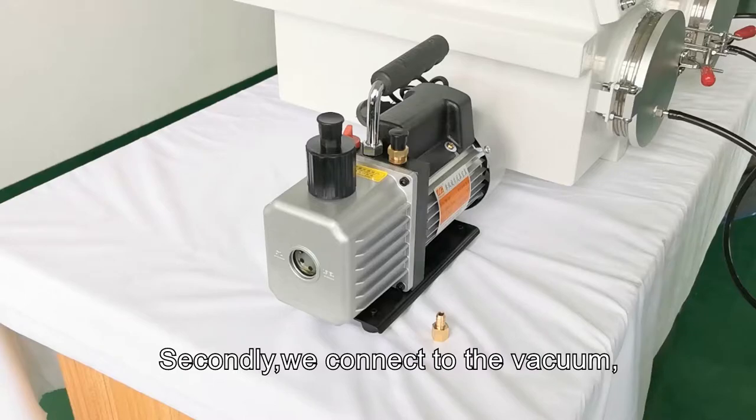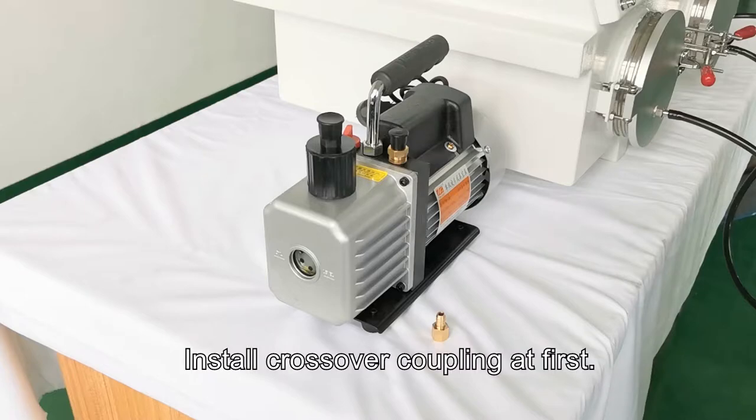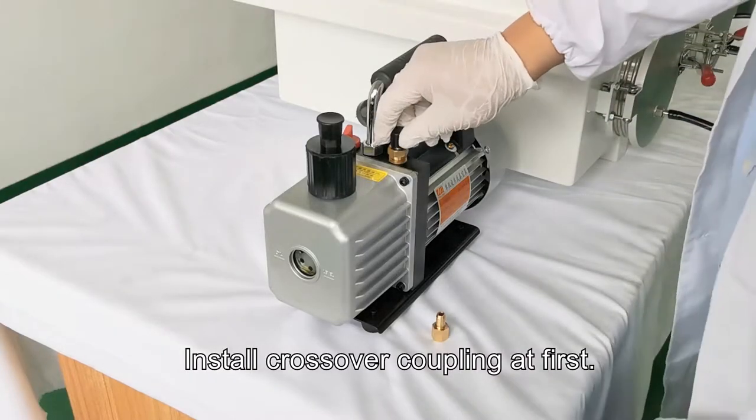Secondly, we connect to the vacuum. Then we will show you how to use the vacuum pump. Install crossover coupling at first.